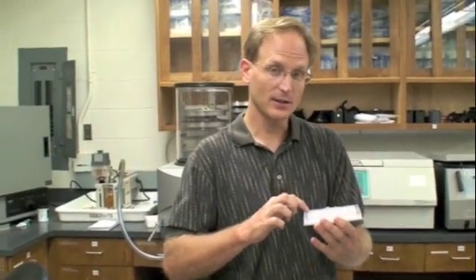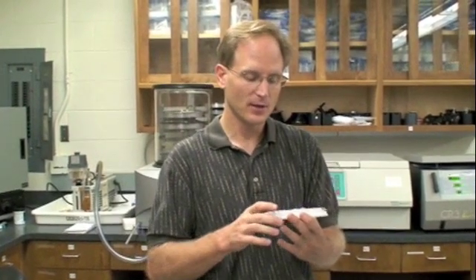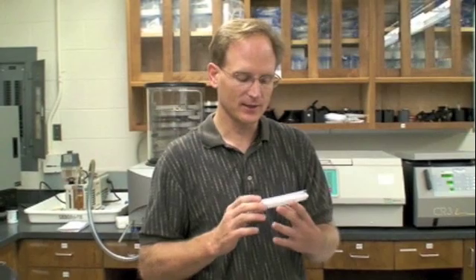What we're going to do is create our own column, our own Sephadex column. We're going to add Sephadex to each of the wells here. The Sephadex needs to hydrate with water. It has some pretty unique properties. We'll add water and let it sit for at least 30 minutes to an hour. Three hours isn't bad.